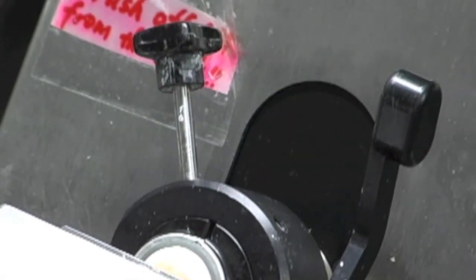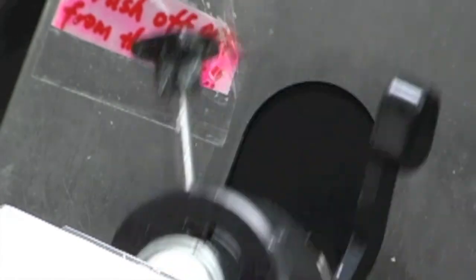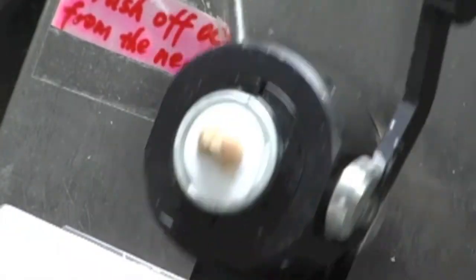Before the cutting begins, the brain must be frozen solid onto a metal platform called a chuck. The freezing will help hold the brain in place and prevent the tissue from ripping instead of cutting.